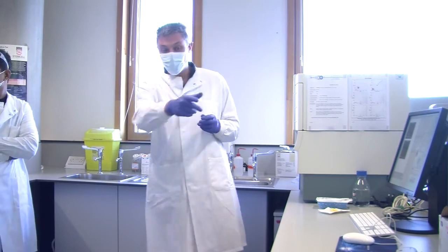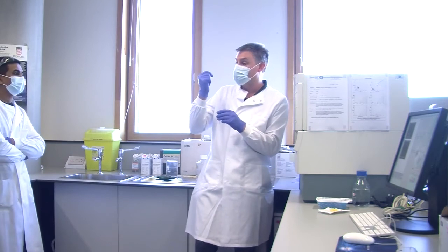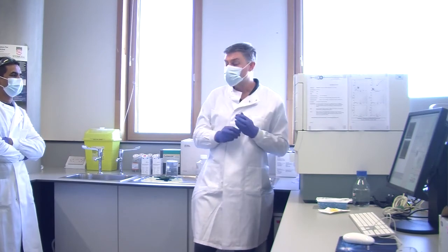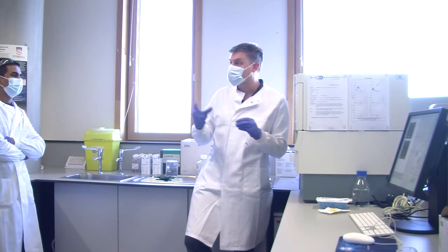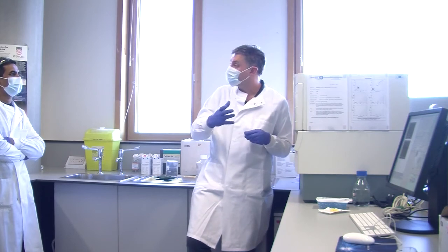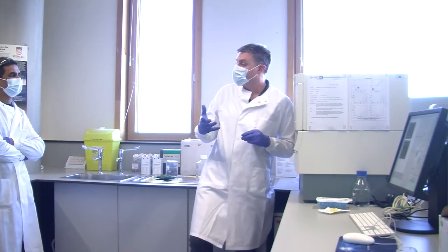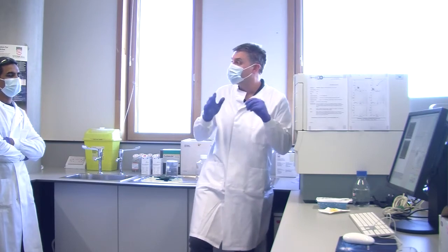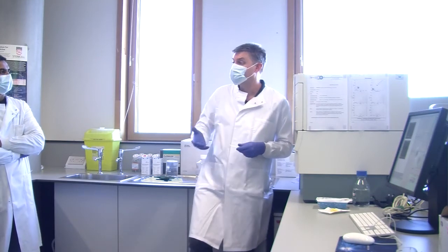You can. You can sometimes use a pipette to break up clumps, but that can sometimes break up cells as well. You can draw it through a needle, which will sometimes work. You can also add 5 millimolar EDTA, which is a chelating agent that can help stop them being sticky too. But EDTA can interfere with some assays. Pipetting them up and down can interfere with live-dead assays. So my standard answer is it depends. Very often there is no hard and fast yes or no. Very often it's, well, it depends on what else you're doing.